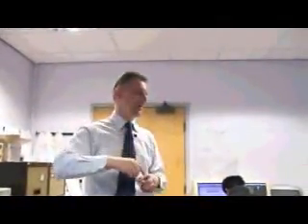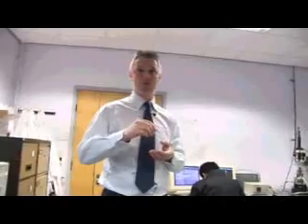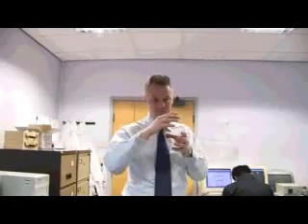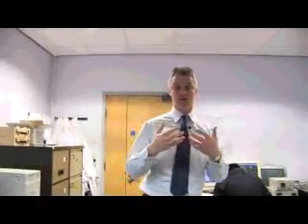Whenever you speak to anyone in our area, they're always saying particles interacting. And when I show you how the microscopes work, basically it really is just a very sharp needle on a... It's kind of like an old-fashioned record player, if people can remember record players, where you had an arm and a needle. The only thing about this microscope is that the arm is absolutely tiny. It's about a fraction of a millimetre in length, and the little point basically has a single atom on the end of it. So when we run that needle over the surface, because that needle is so sharp, we can actually see, for example, things like single proteins.